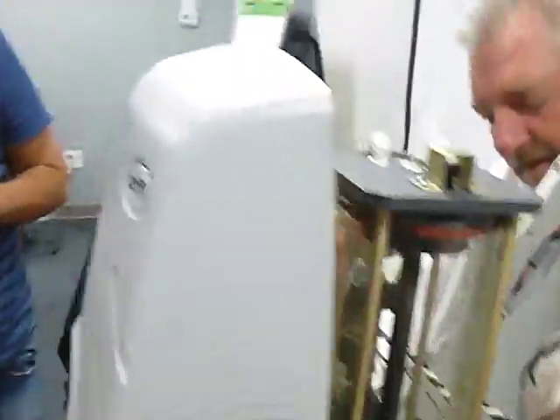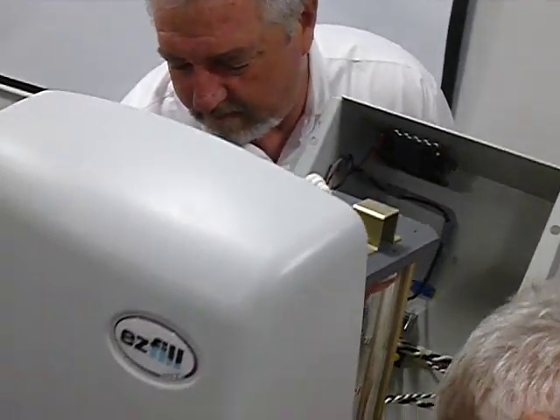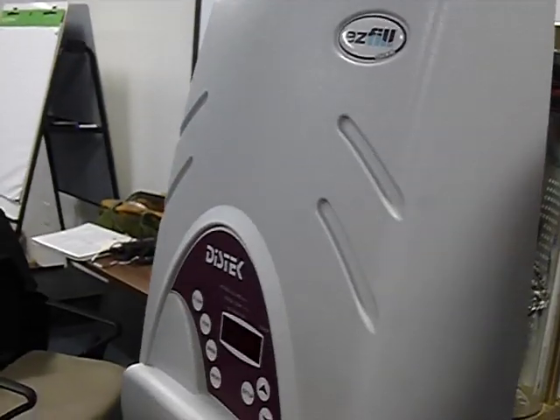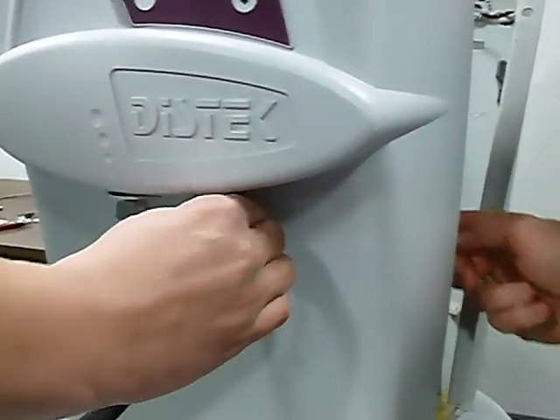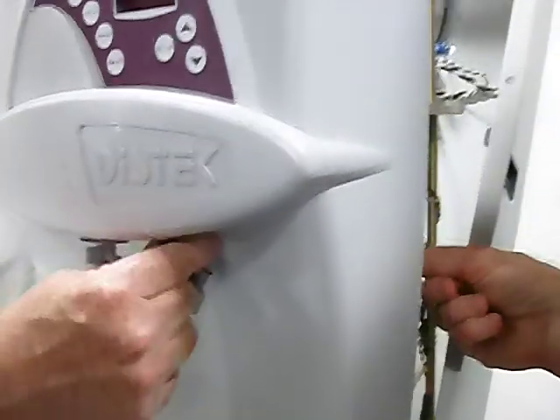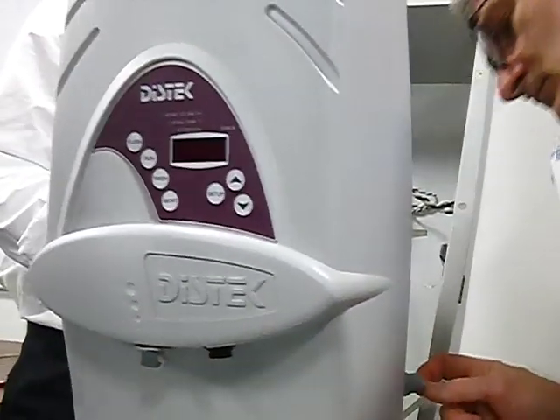The heater. Yep, let me take this front cover off. Can you get that? How do you disconnect these cables here? Okay. Go like this. Yeah, that one I know, the second one. Twist it down, pull it. It's so hard. It's okay.